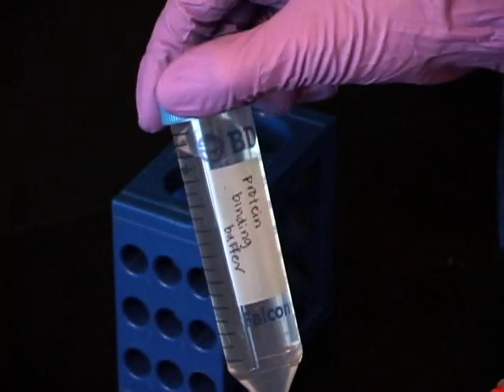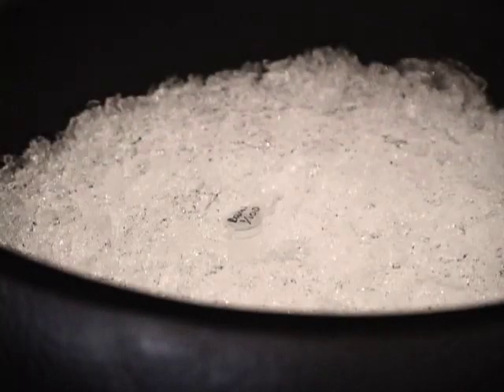Add binding protein buffer if appropriate. And finally, your binding protein.